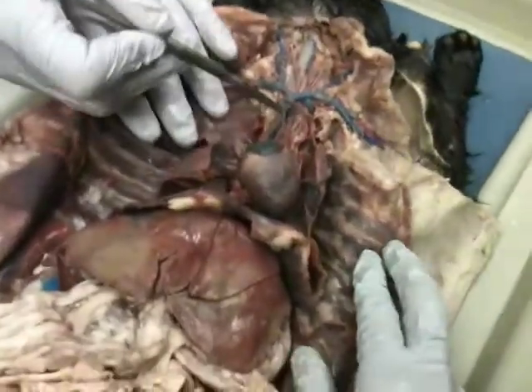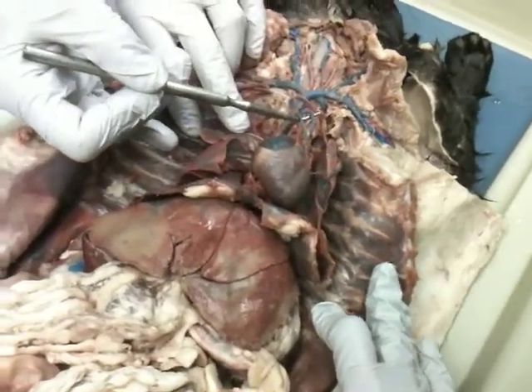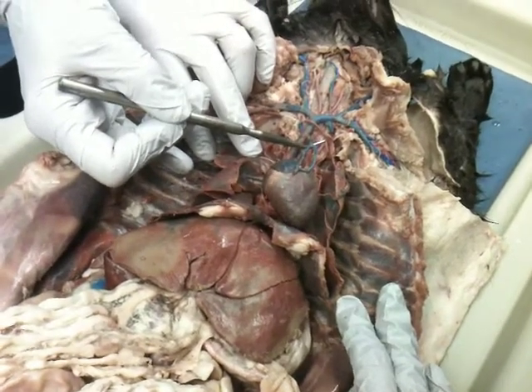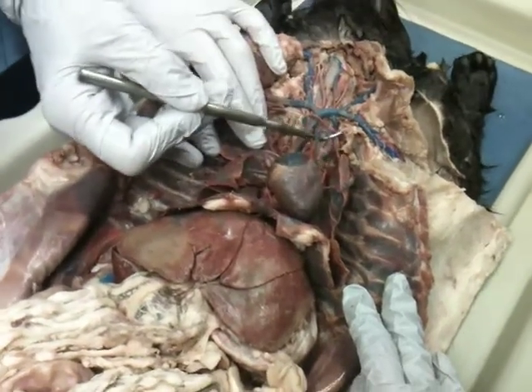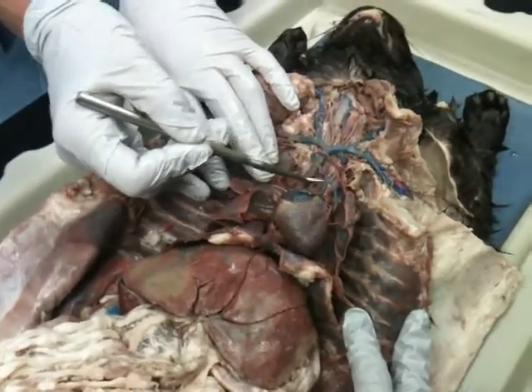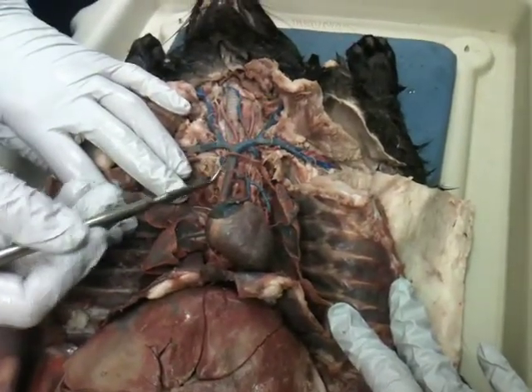Superior vena cava. This is the internal mammary vein. Also, it's known as the trunk of the internal mammary. In some places, you might see it as thoracic mammary trunk, something like that. So sometimes you see things with different names. If you call this the internal mammary vein, that's fully acceptable. This is the vertebral vein, this guy on the side here.